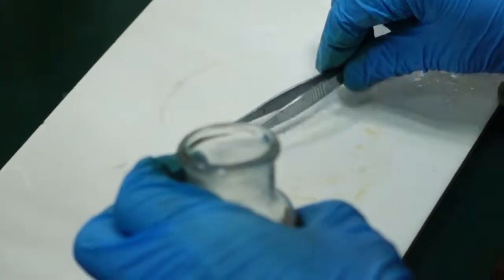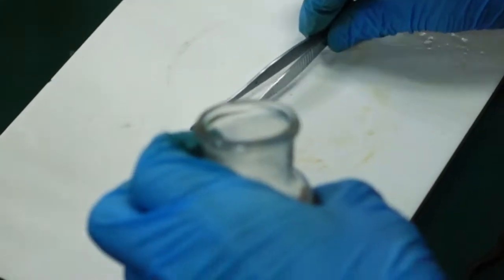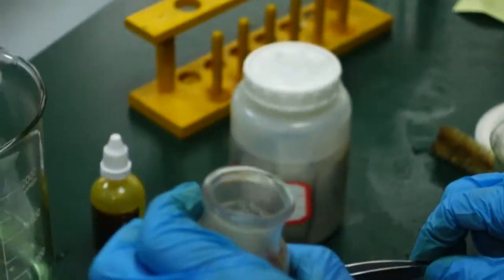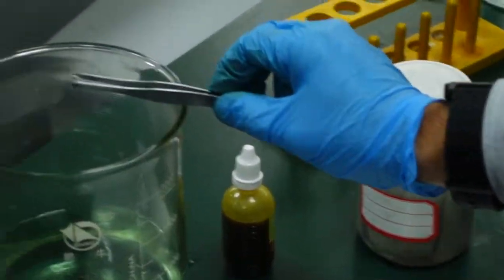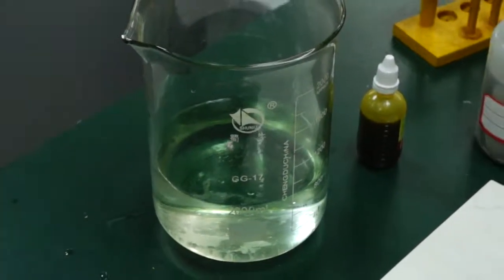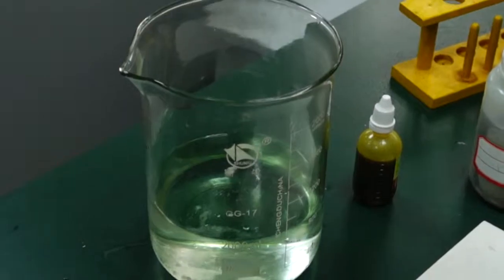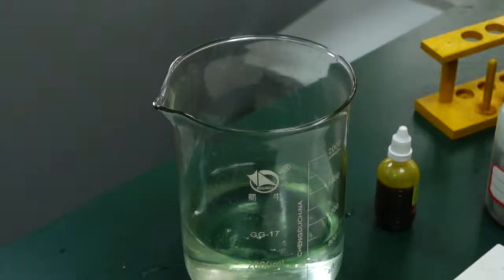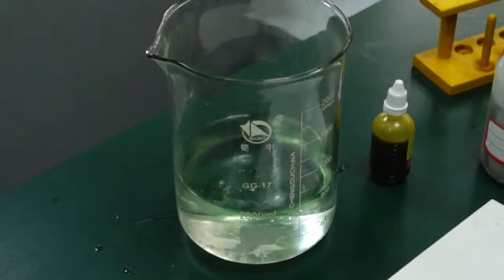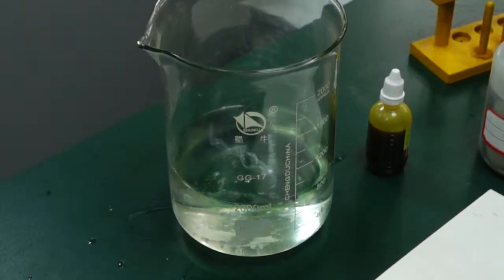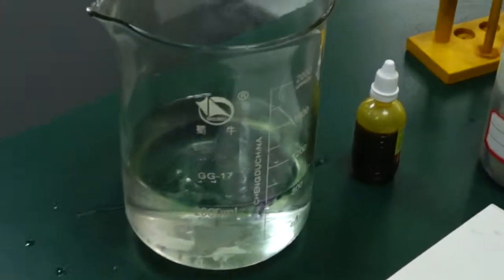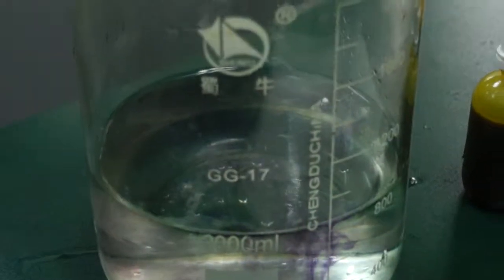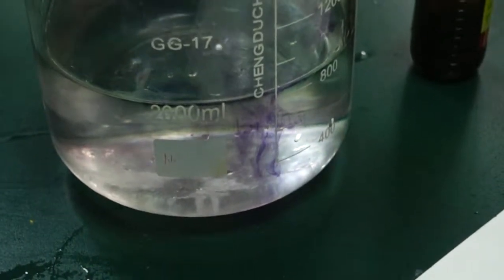Press them together... no, probably not. Oh well, two small pieces, let's go with small. This is the biggest piece we have I think. Ready? Just wait. Oh, just the oil on the outside stopping it from reacting at first. Look at the color change!